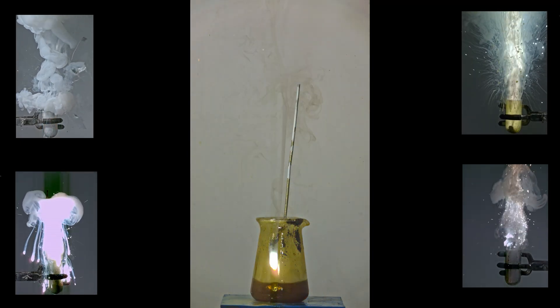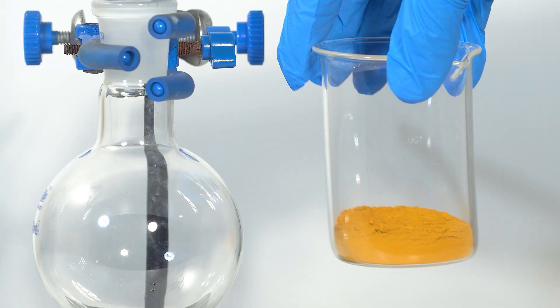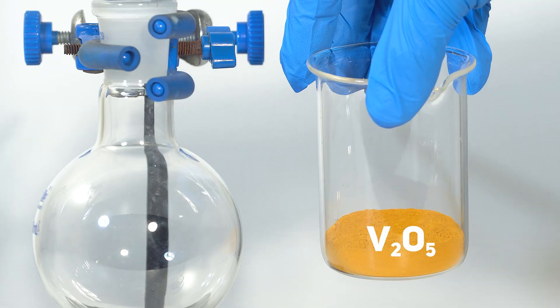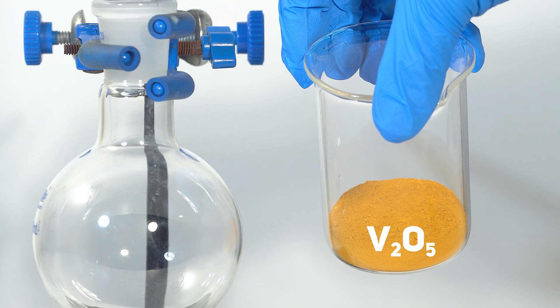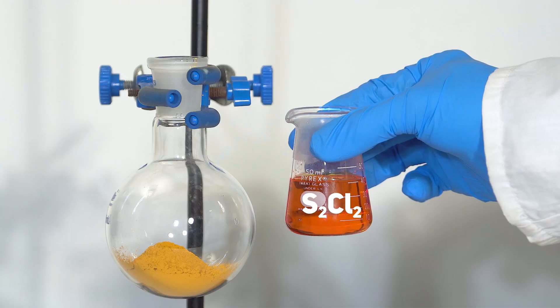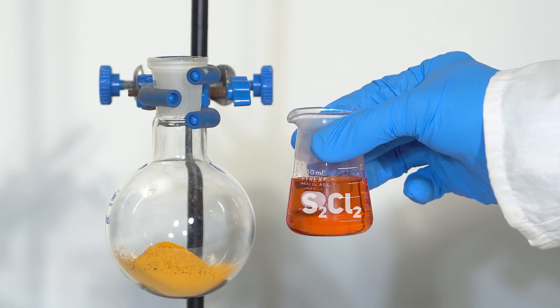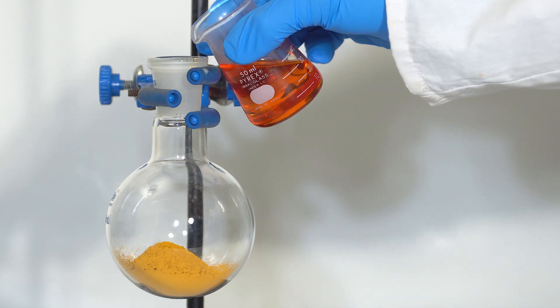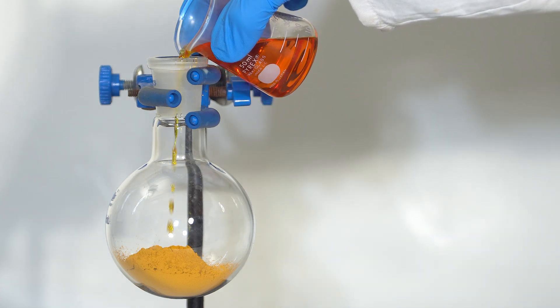Now let's proceed to the synthesis of vanadium trichloride. To do this, I'll take an ordinary one-neck flask and place vanadium pentoxide in it, which I'll boil with an excess of disulfur dichloride for 8 hours. Take care.